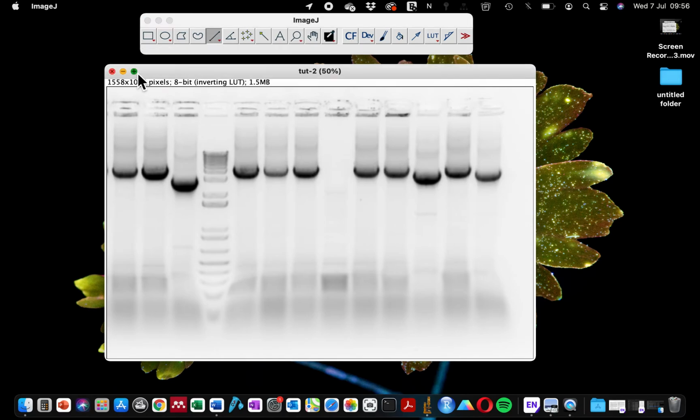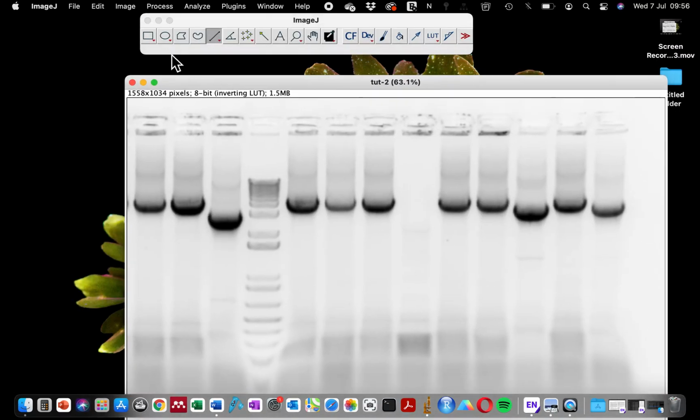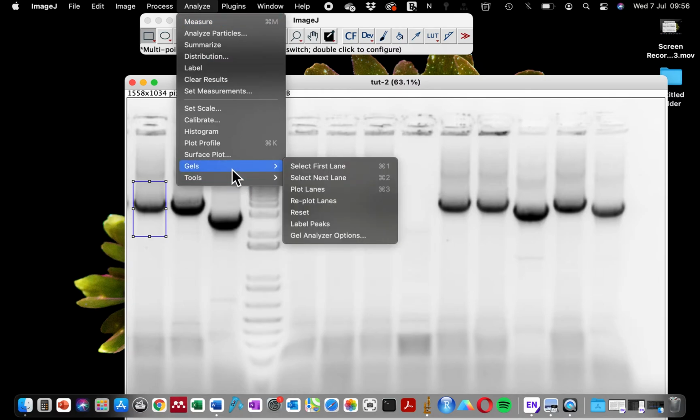And in order for us to do the quantification, we need the rectangle selection tool. With the rectangle selection tool, you can draw on your gel. You can draw this blue rectangle around the band on the gel. And then you go to analyze gel and select the first lane.